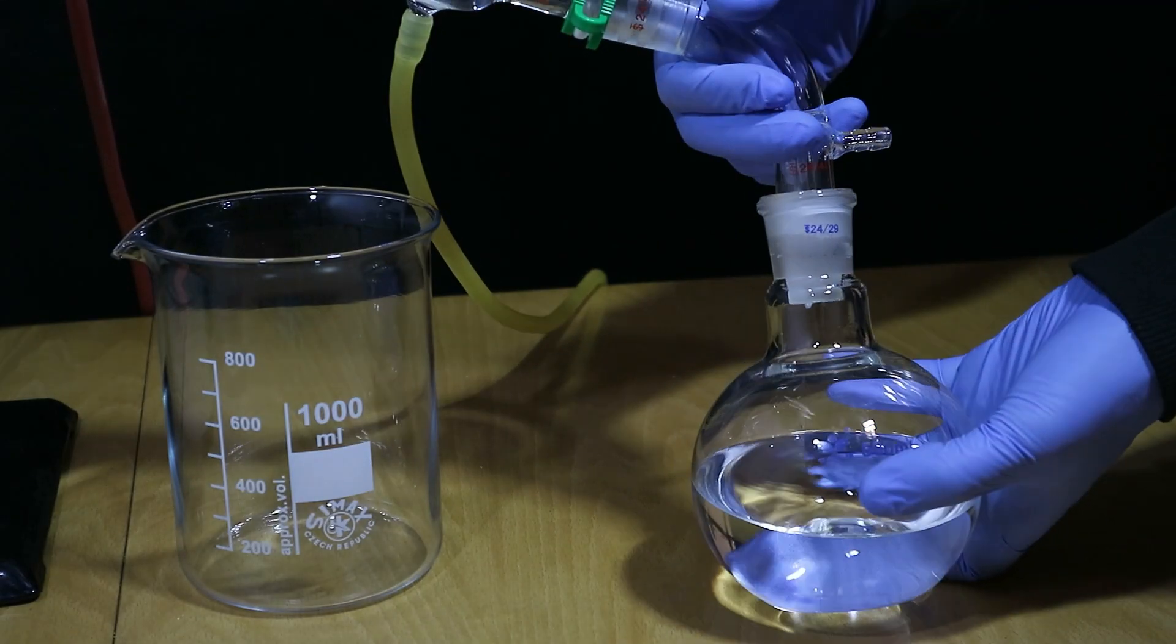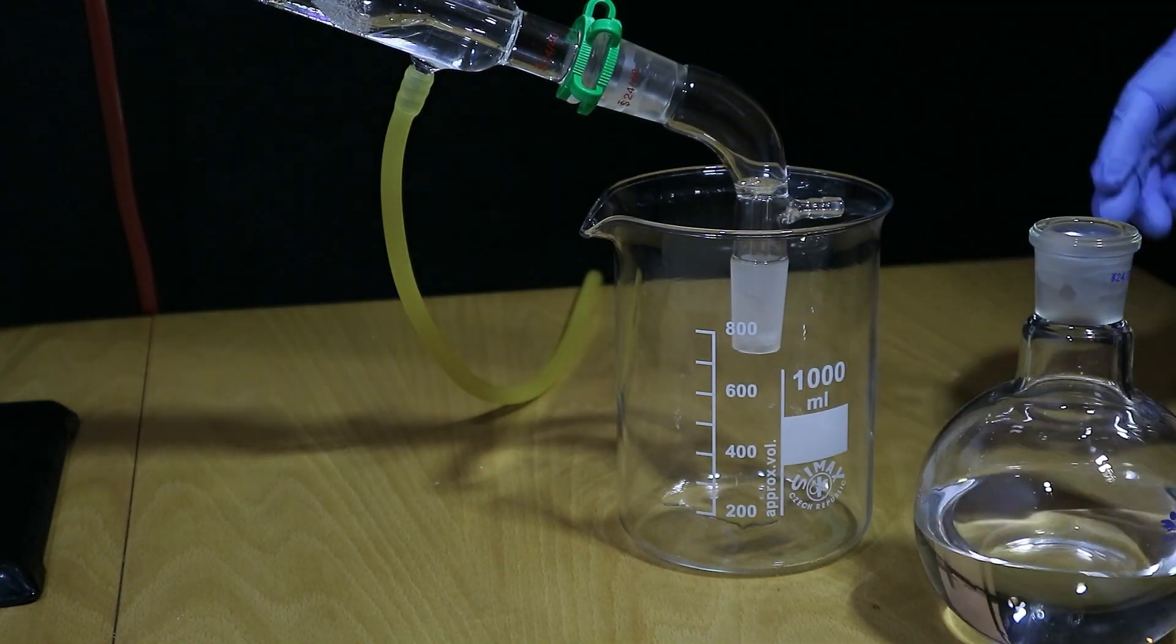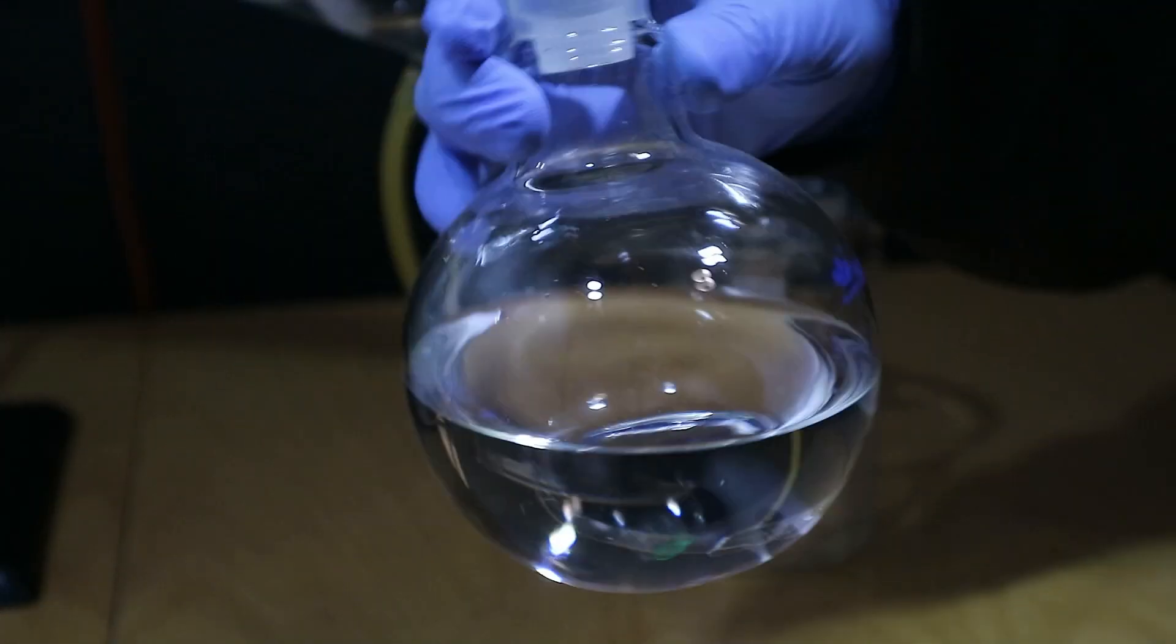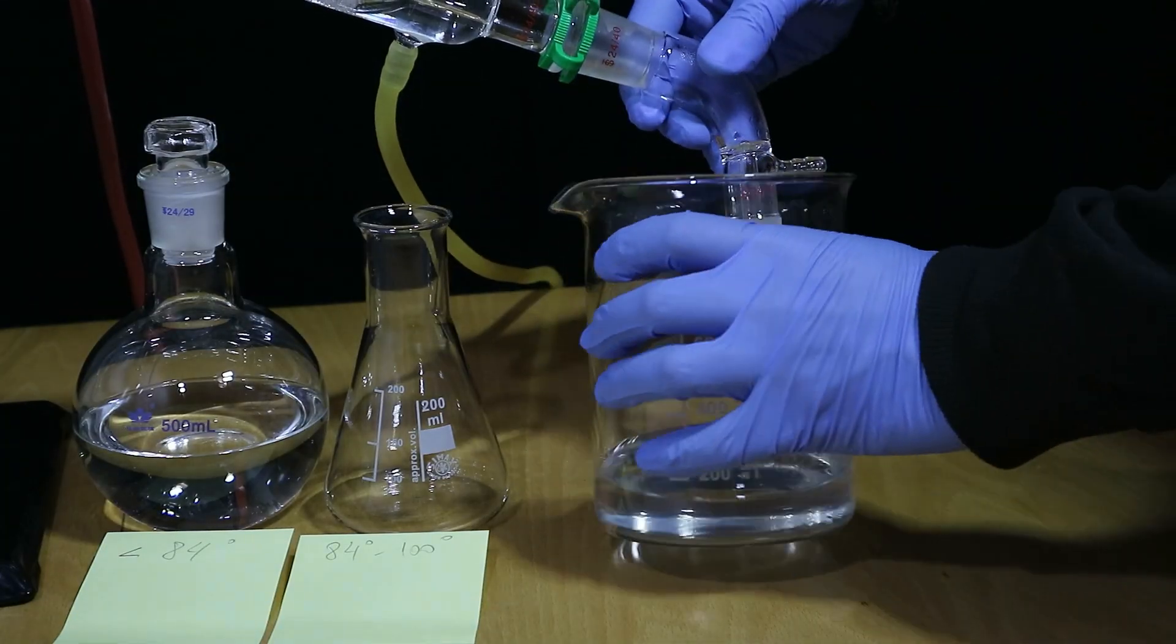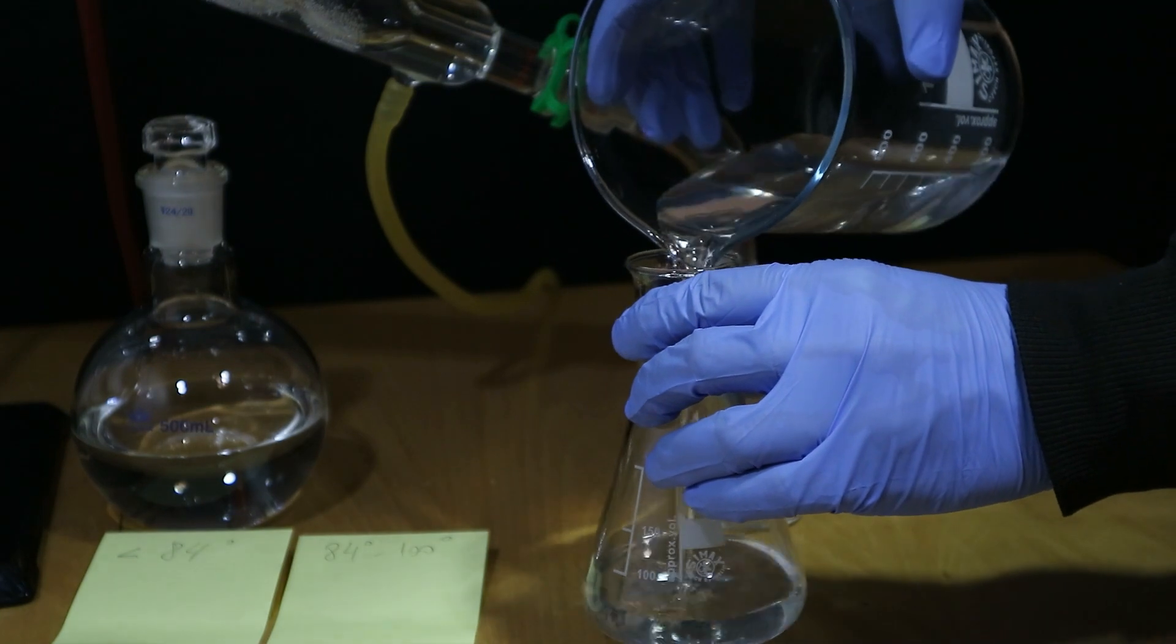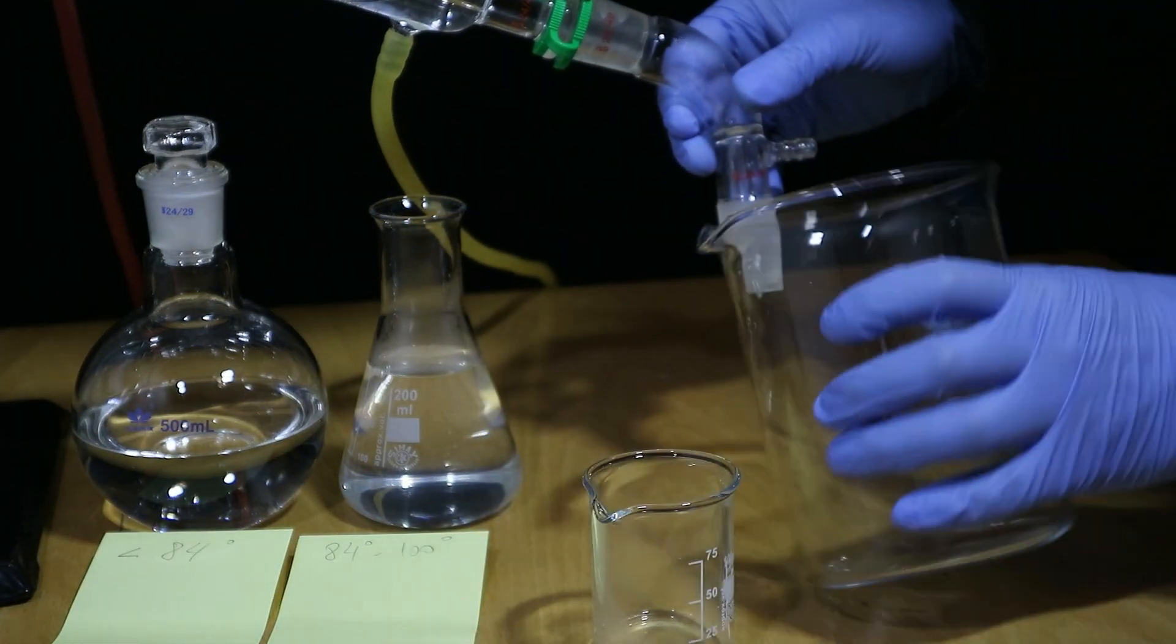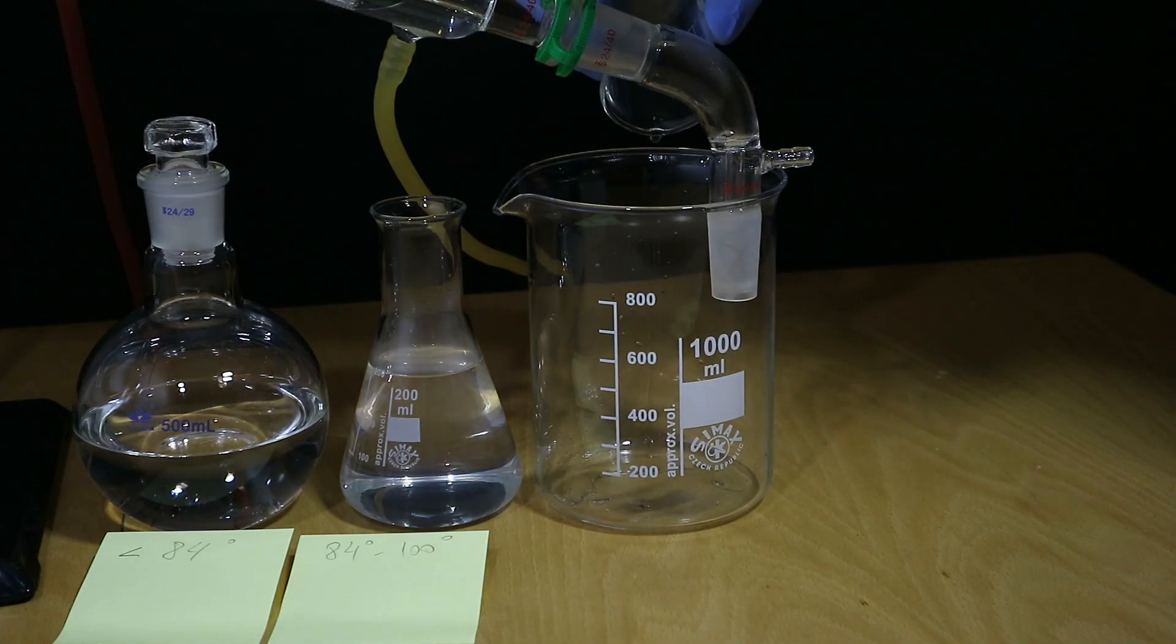I collected the fraction of between 78 and 84 degrees since ethanol evaporates at around 78. The rest I divided into two more fractions of like under and over 100 degrees. They both contained water and essential oils that had a lot of aroma but no real taste in my opinion. I could recognize some of the herbs though and it was a nice bouquet which smelled very sweet as I flushed it down the drain.